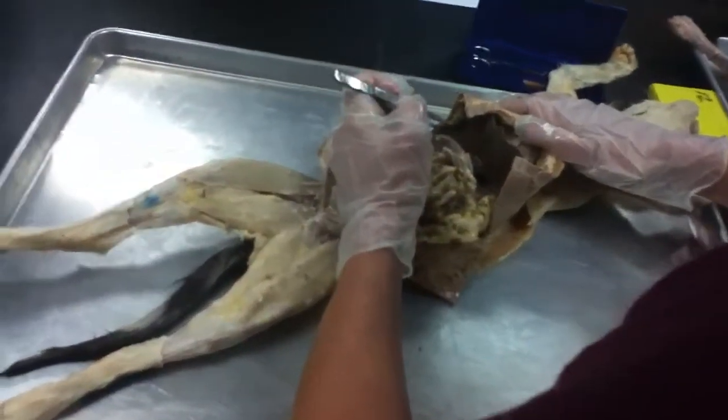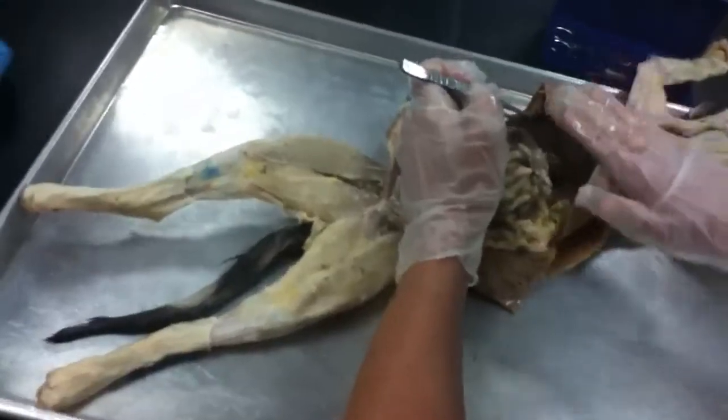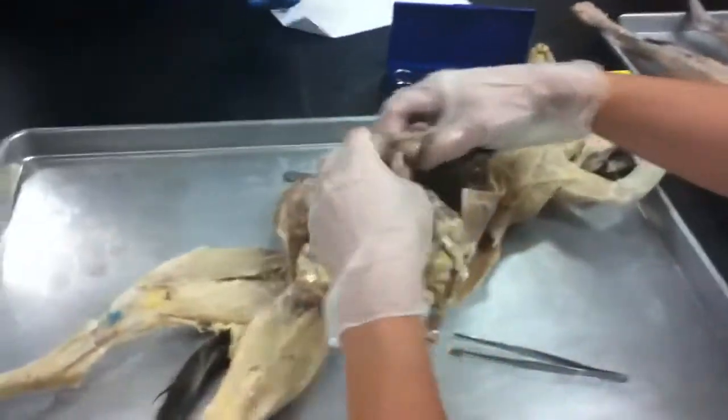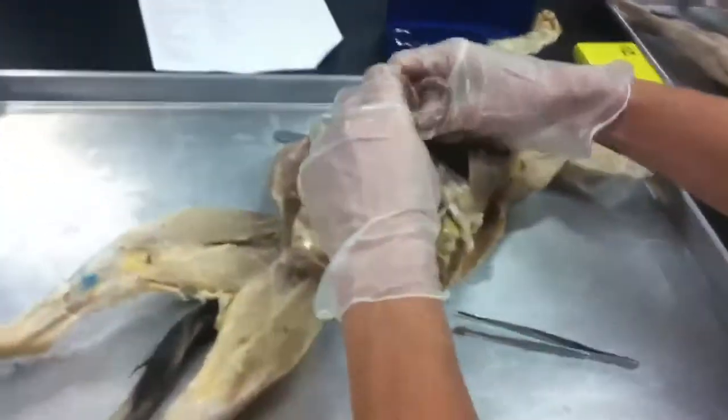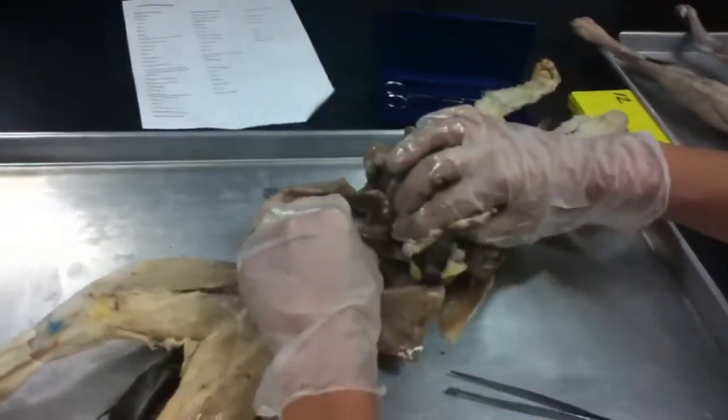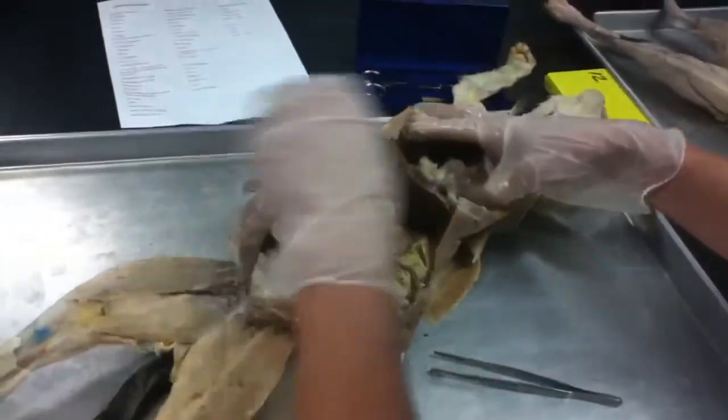What else? Let me just look real fast. So do the lobes of the liver. Find that. Find your ligament. Yesterday we did the mesenteries, right? The intestinal mesentery. Yes, this one. And then the one that was holding down the colon was the mesocolon. So intestinal mesentery, mesocolon. All right.